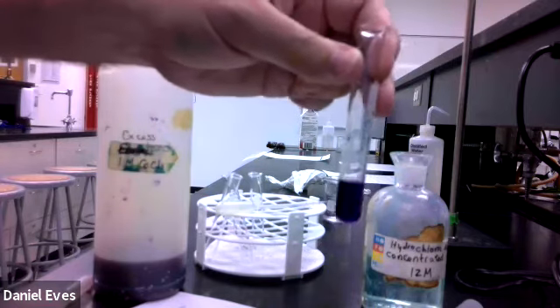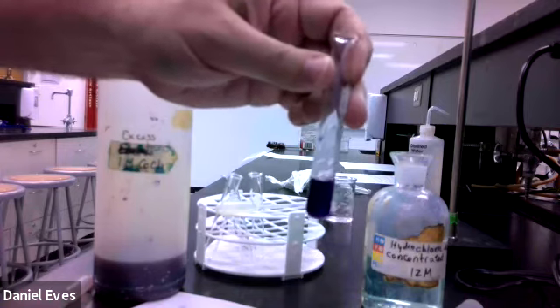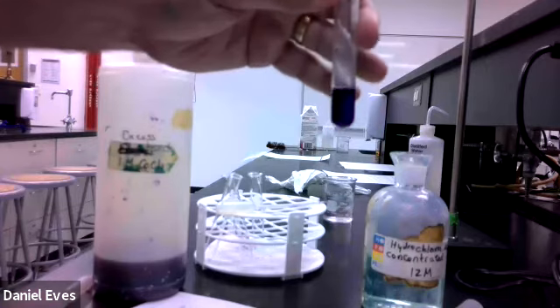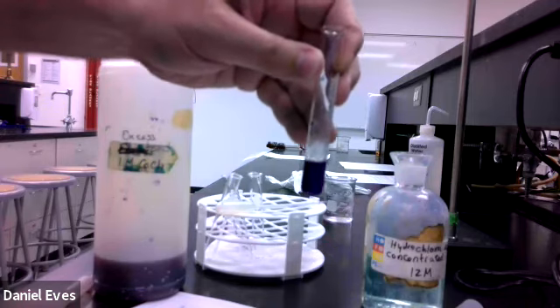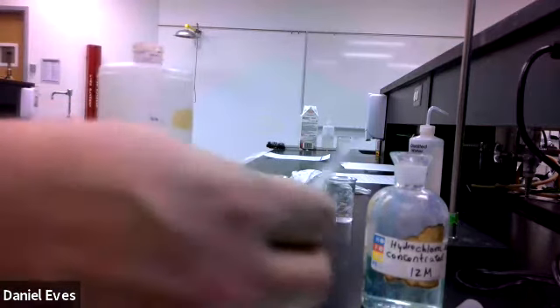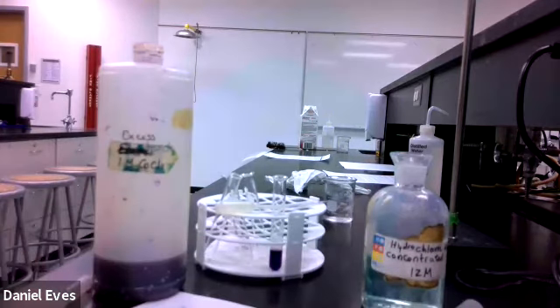Okay, so there is an equilibrium that's going on there, and we're surrounding the cobalt now with chloride and not water. And so that's the different compound that we see, and that's the color that we get from it. So we're taking the water that's hydrated and now surrounding it with chlorine, and it is giving us that color. So now we need to investigate that equilibrium. So let's go ahead and put our dropper down and see if we can find some things to help us find the equilibrium. So I'm going to look around real quick and come right back.